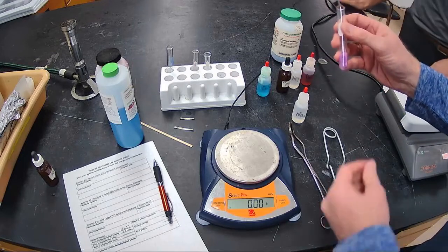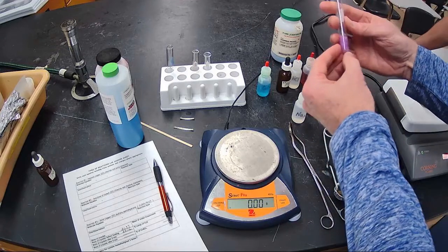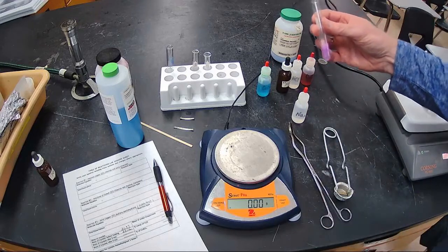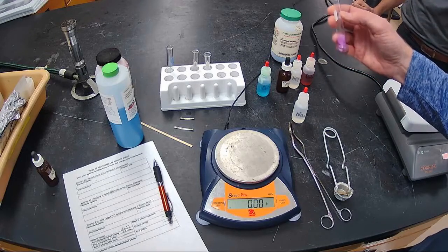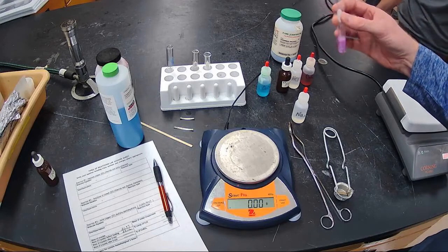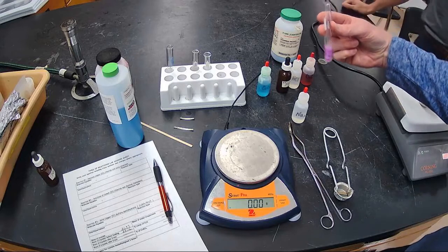So I want you to describe what you're seeing here. It looks kind of gelatinous with a little bit of powder to it, to me. I kind of imagine what the inside of a marble would be. Yeah. Good analogy. Like you have a clear marble and it looks like a little cat eye or something inside of that, but it looks a little gelatinous, a little powdery. Yeah. It's kind of cool, right? Yeah. So a nice pink purple color.